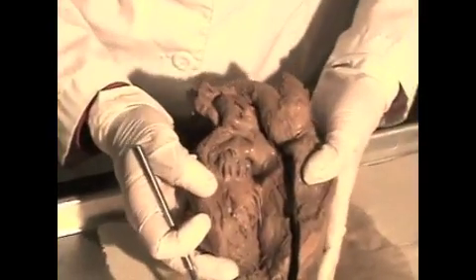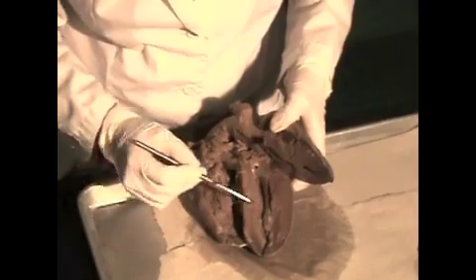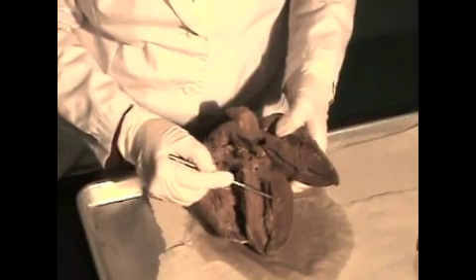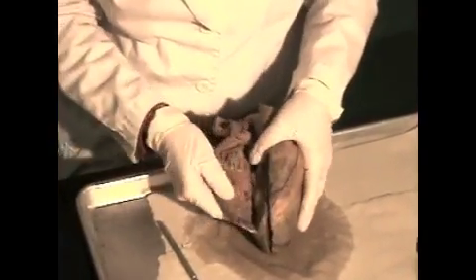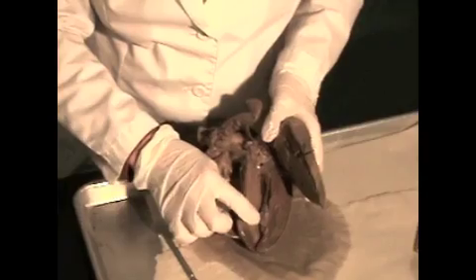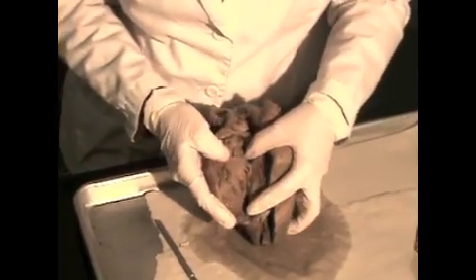This is the entire right side of the heart opened up. And this heart also has the left side of the heart opened up over here. You want to first take note of how thick that left myocardium is as compared with the right side myocardium. The right side of the heart is only sending blood to the lungs, so it's much less muscular than the left side of the heart, which is sending blood to all of the body parts. We're just going to focus on this right side and look at some things of importance.